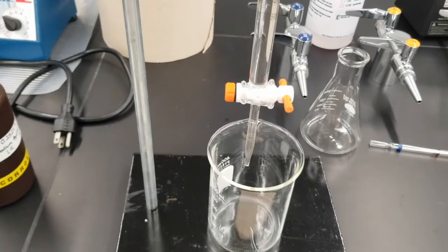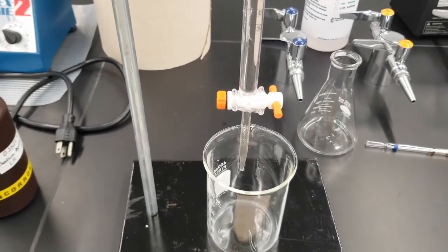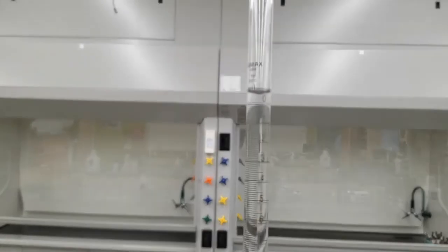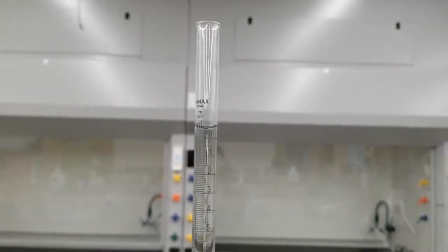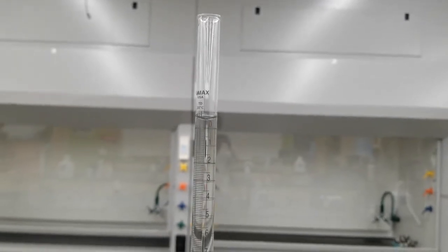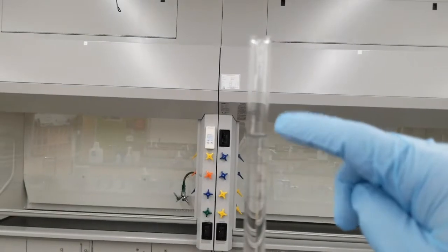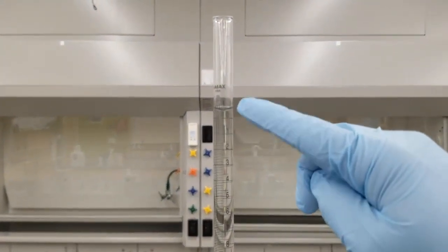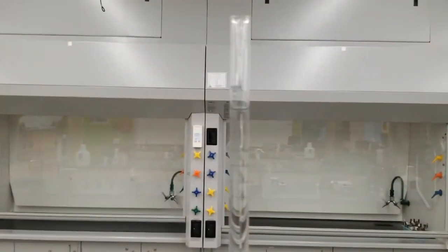So this is the only time we actually have to do this step. Whenever I refill my burette from now on, I don't have to go past that 0 mark. In fact, I really shouldn't. Now, if I look at that level, you can see that I'm still past the 0, and that's not good. We want to be able to read our volume, and there are no volume markings past that 0 point, so we want to make sure that we let out sodium hydroxide past that 0 marking. So I'm going to go ahead and do that.